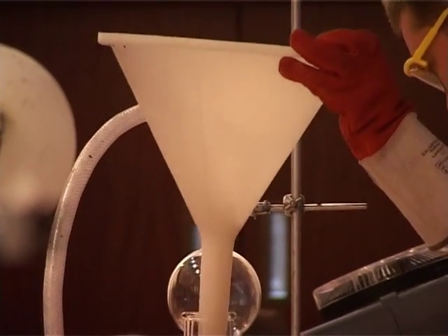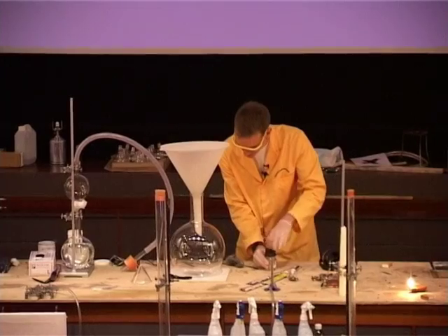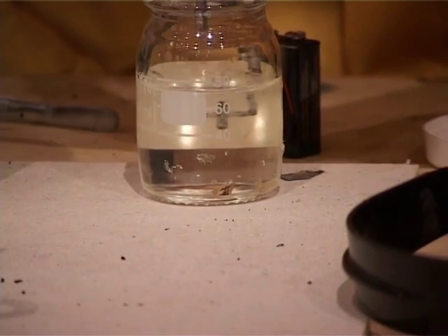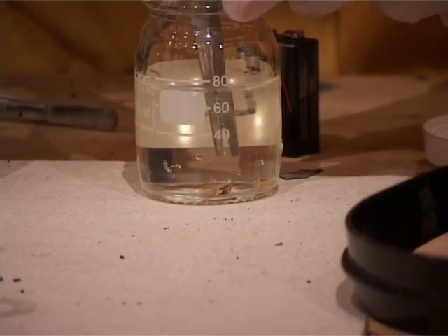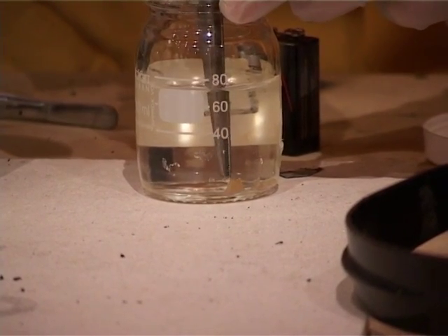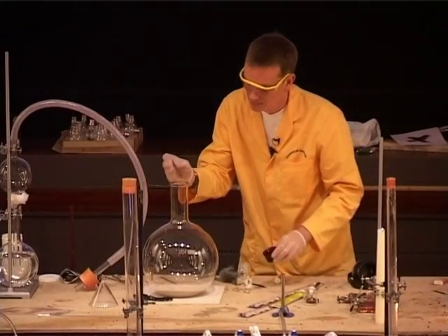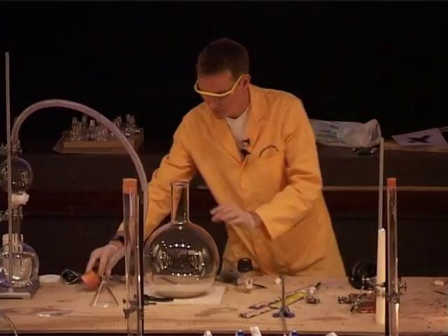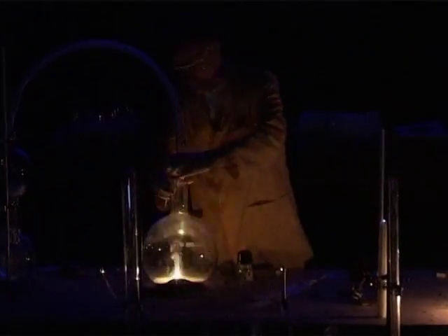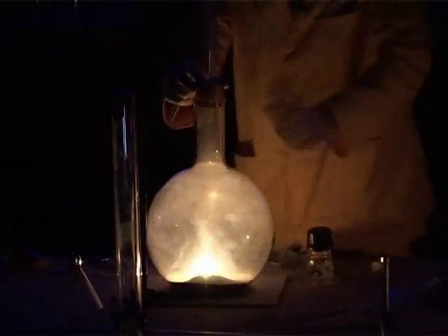Let's get the phosphorus out. I'm just picking up a tiny little piece. So, it's on the sand — and it's already caught fire.